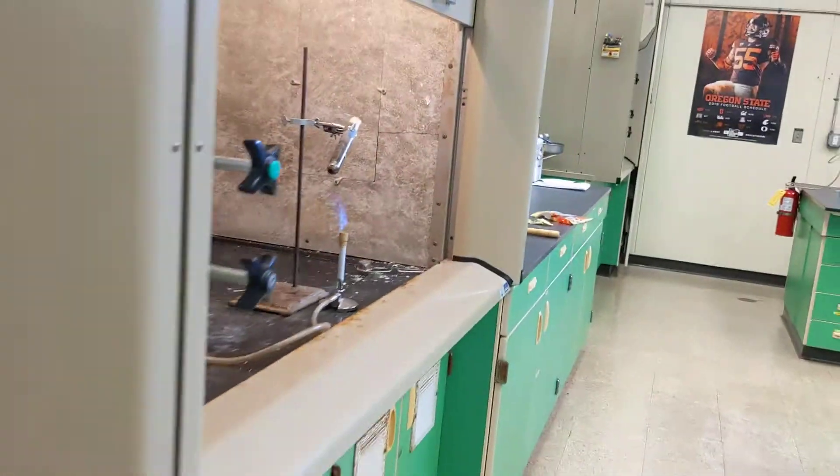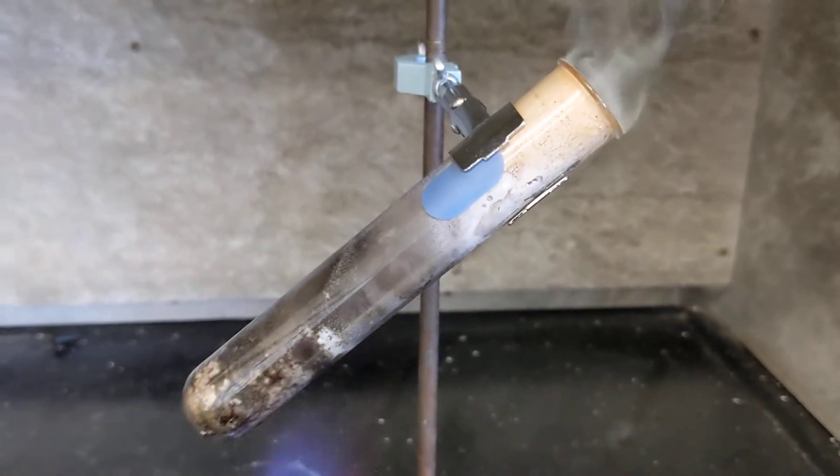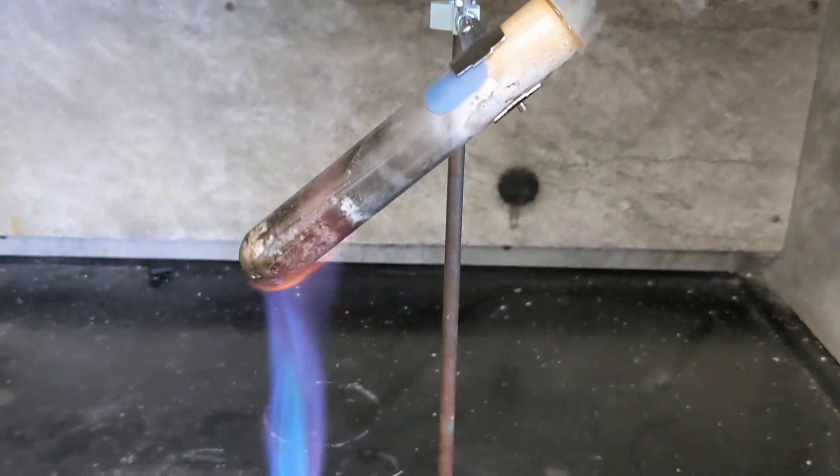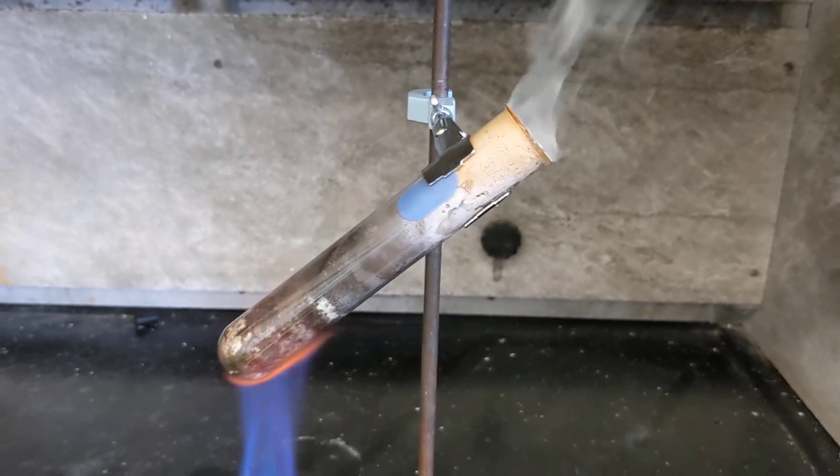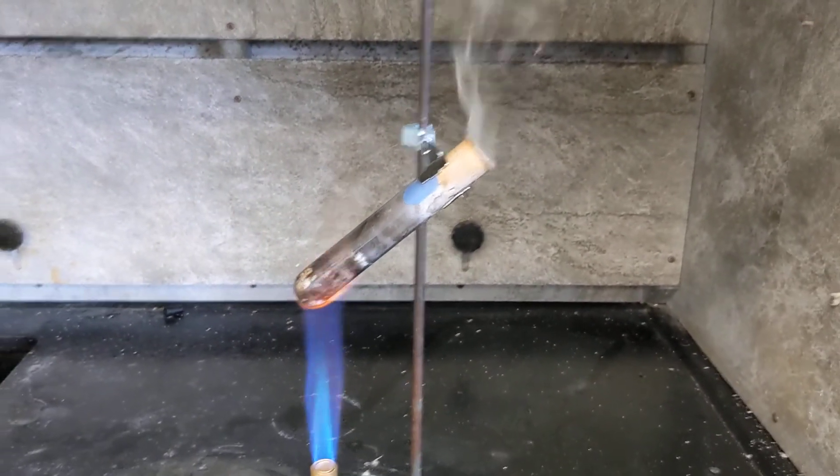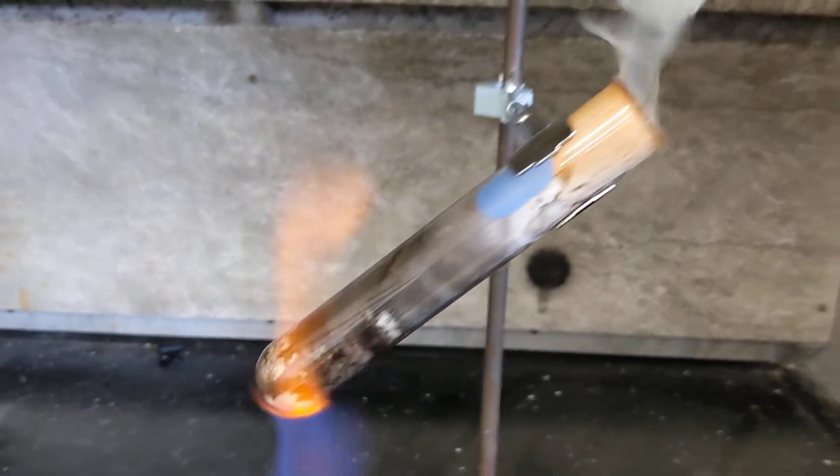Turn this off. And we'll just try. Nope. I think we're about out. So I've done this reaction enough to know how much to use. So I think I used about a one gummy bear amount this time. But let's do the stoichiometry. Oh, you can hear a little popping left, but not much.